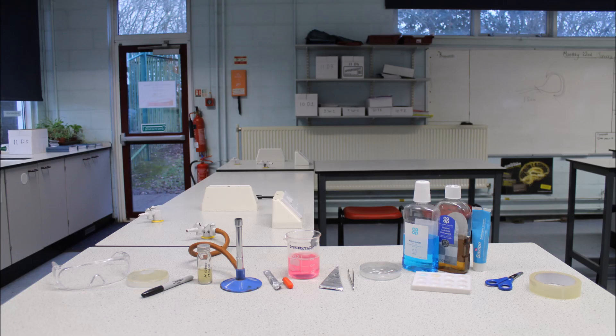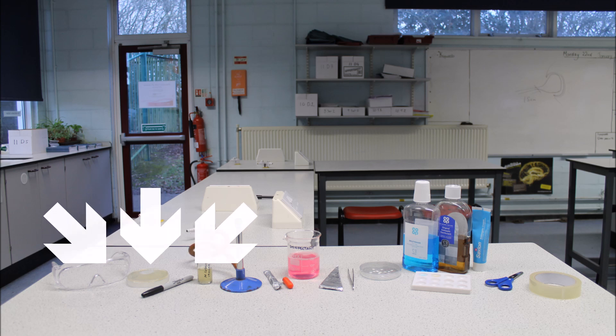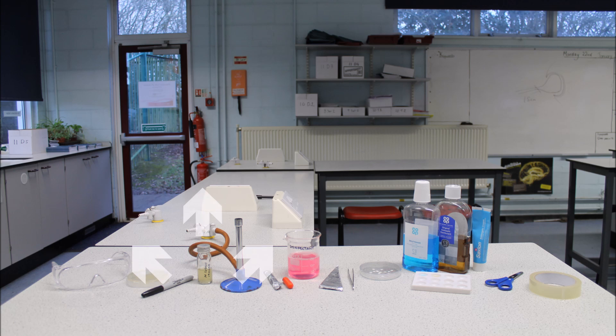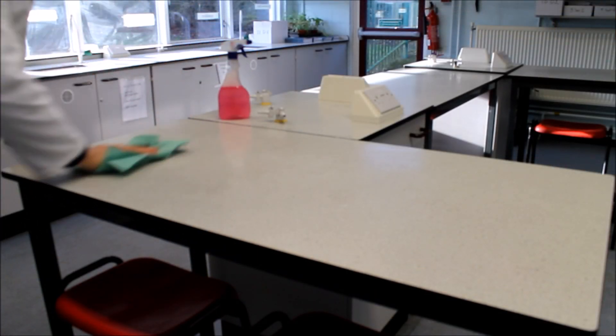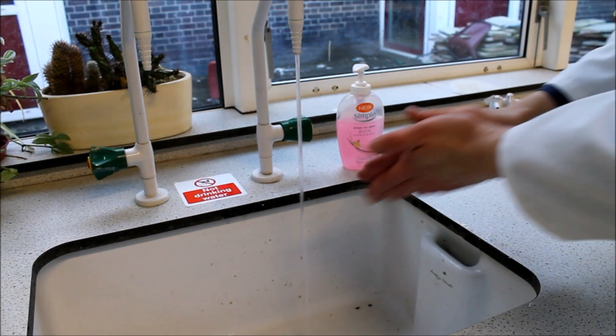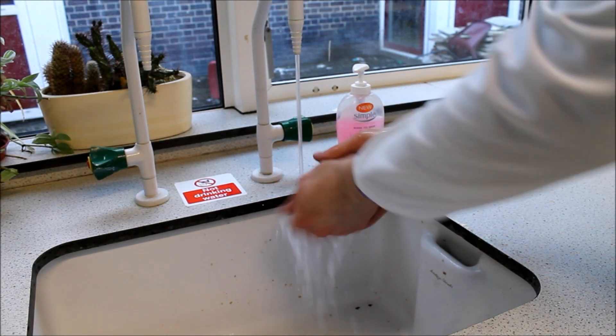Before we begin, it is important to point out that the method contains steps to prevent contamination and together these are called aseptic technique. Contamination can occur when microorganisms from your surroundings get onto the agar plate and spoil your results or when bacteria from the investigation get into your surroundings and cause a potential health hazard. The first thing you must do is clean the desk with disinfectant. Then wash your hands using antibacterial soap and running water.